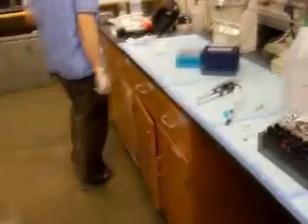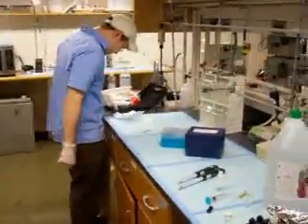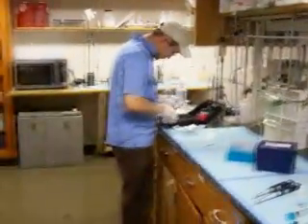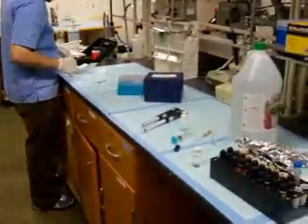Tools. They need to provide better tools than this spill kit, which probably costs on the order of like $50. Perhaps someone's pilfered the brush. I don't see it. Okay. Not sure what to do. We're gonna have to improvise. Data collection continues.